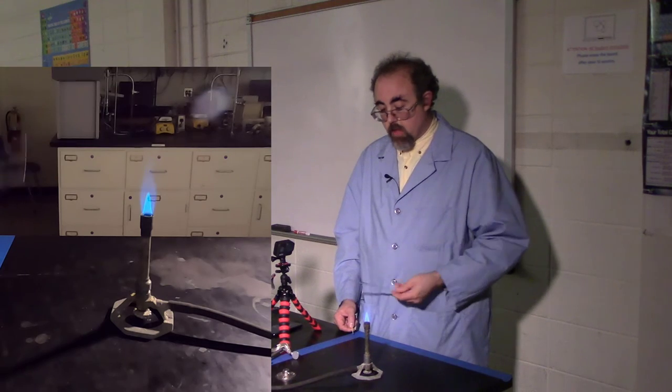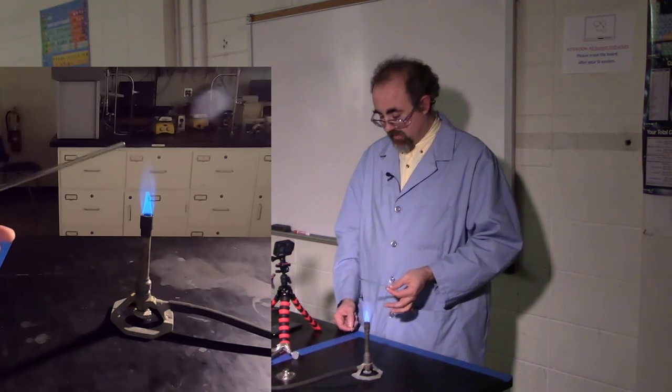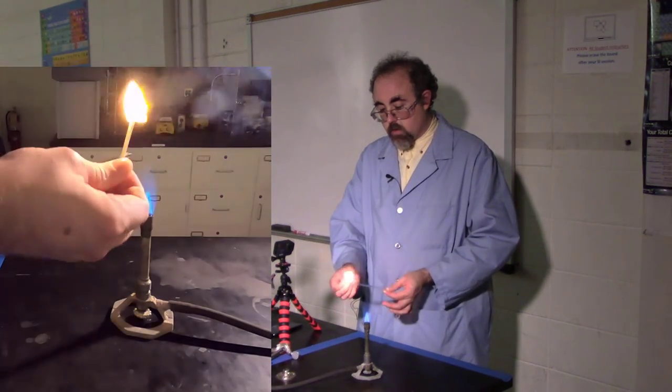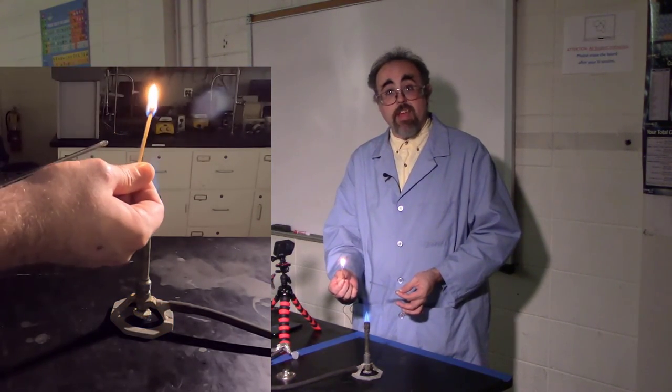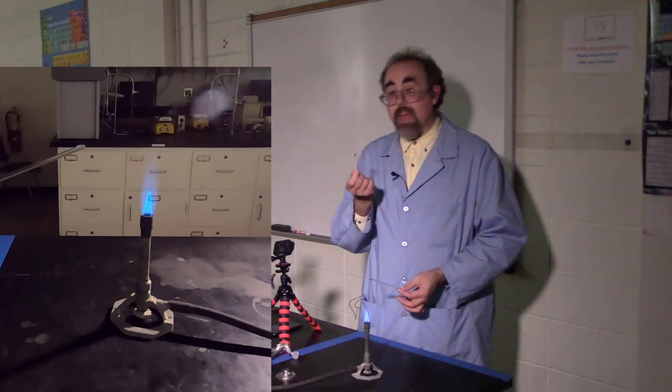Now, I should point out something. My glass stirring rod has been in the flame. It doesn't necessarily look hot, but it is hot. So do be careful. Hot things don't necessarily look like hot things.